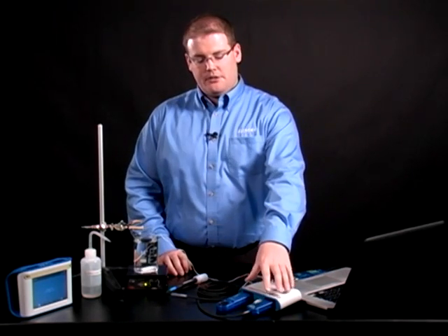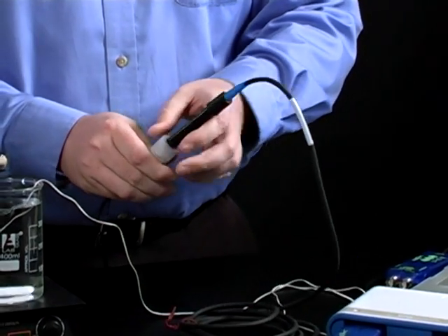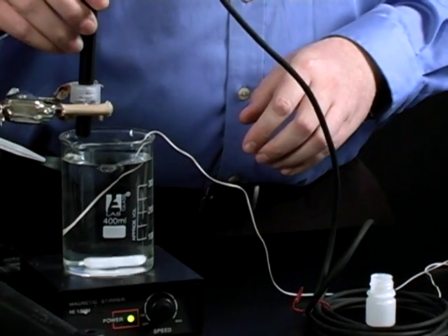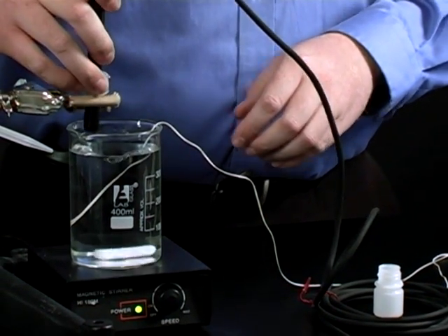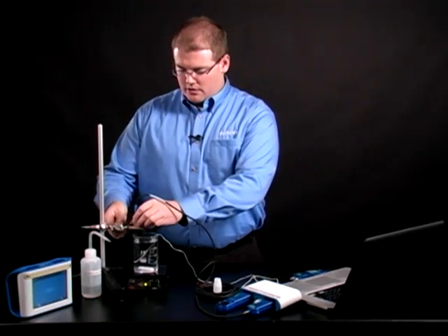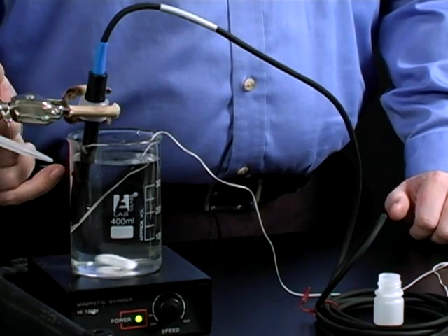To begin, connect your sensor to your interface and place the probe into your water sample. It's best to let the probe equilibrate with the sample for several minutes to make sure that it's at temperature equilibrium. Also, make sure that the probe is submerged below the silver ring found on the probe if yours has one.